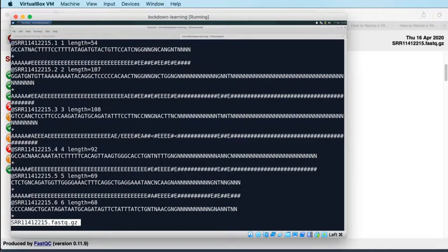The third line is then a separator between the sequence information on line 2 and the quality information that's encoded on line 4. It's usually just a plus character, and it always begins with a plus character. You can have other stuff on there, but the way that we've encoded the FastQ, we've got no other information on that line, so it's just a plus for a separator. And then the fourth and final line of the entry is the quality information.